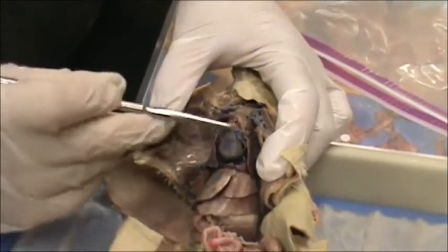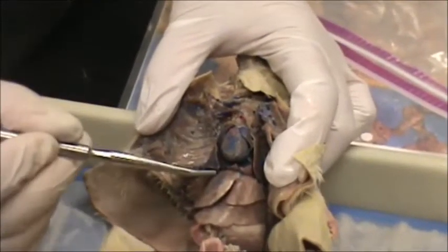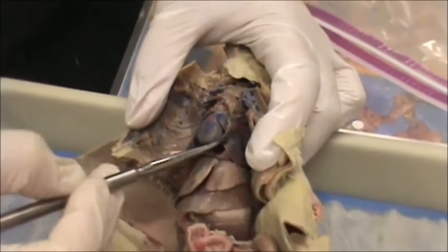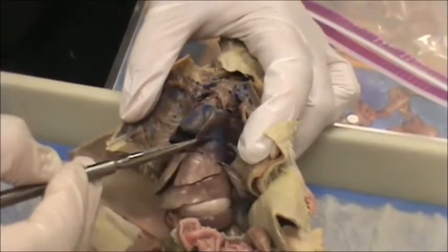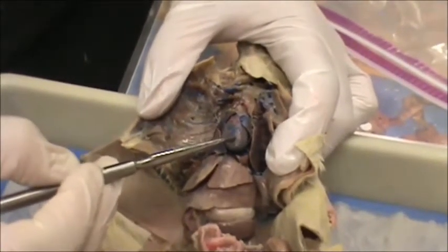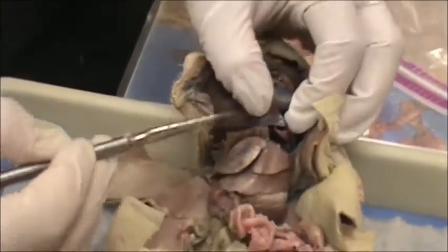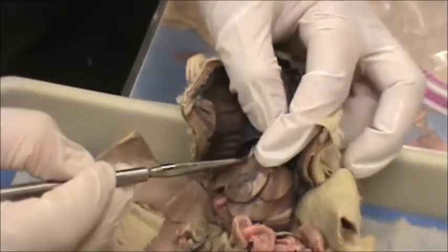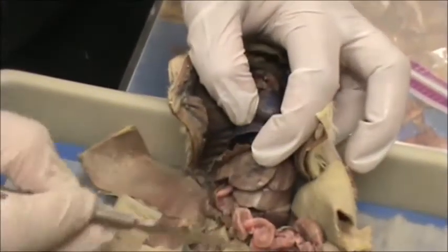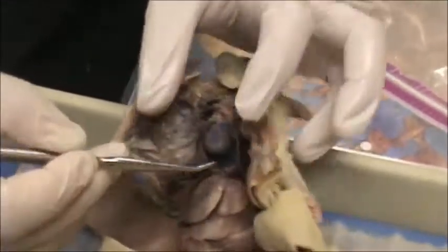This is the respiratory and circulatory system. These right here are the lungs, and this is the heart. And below all of this is the diaphragm, which is a muscle that separates the abdominal cavity from the thoracic cavity.